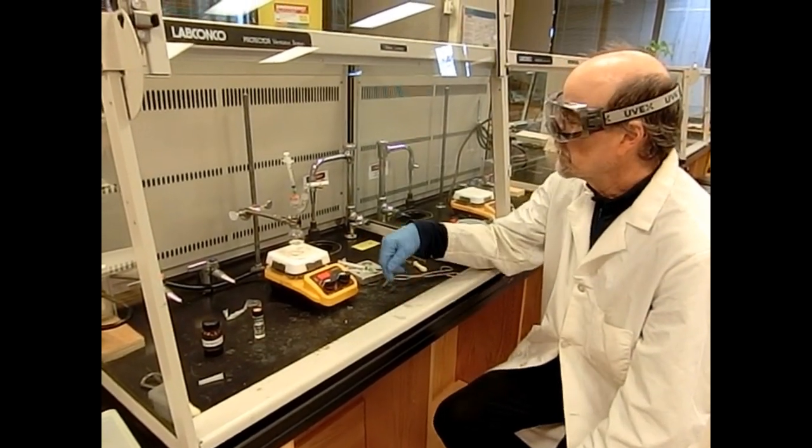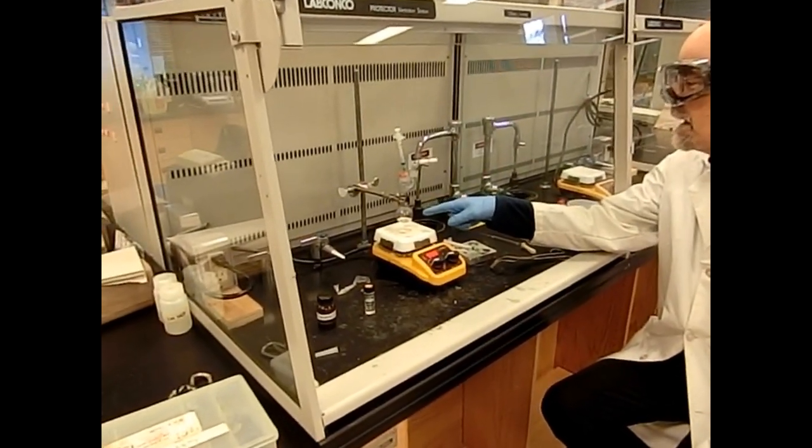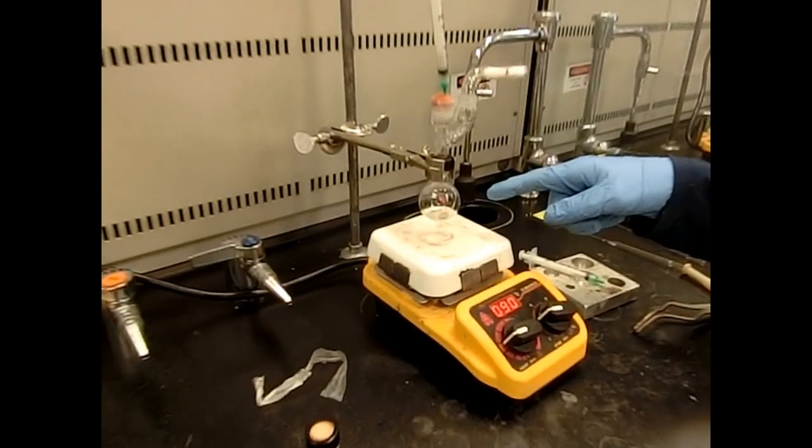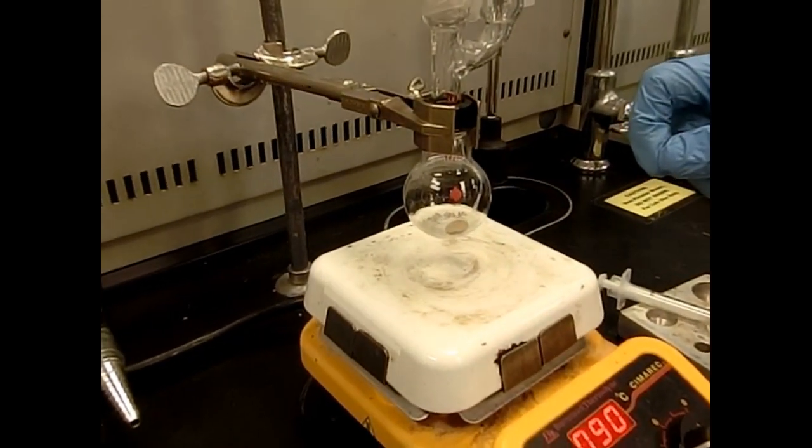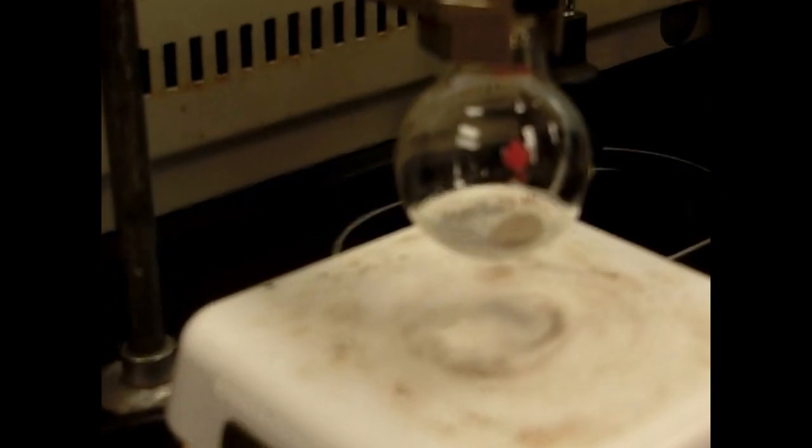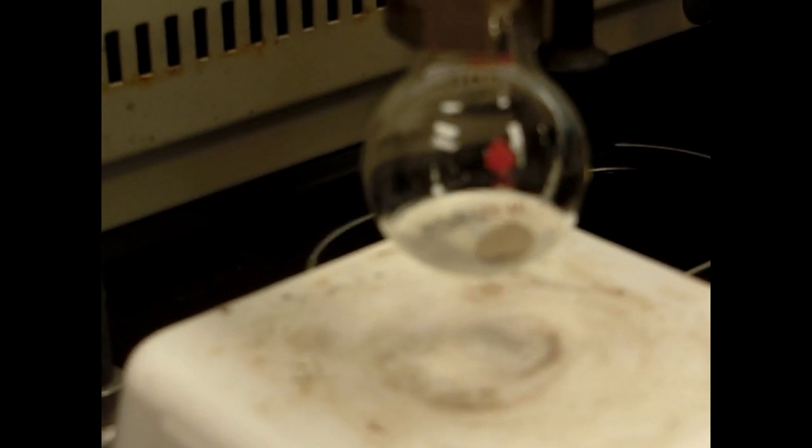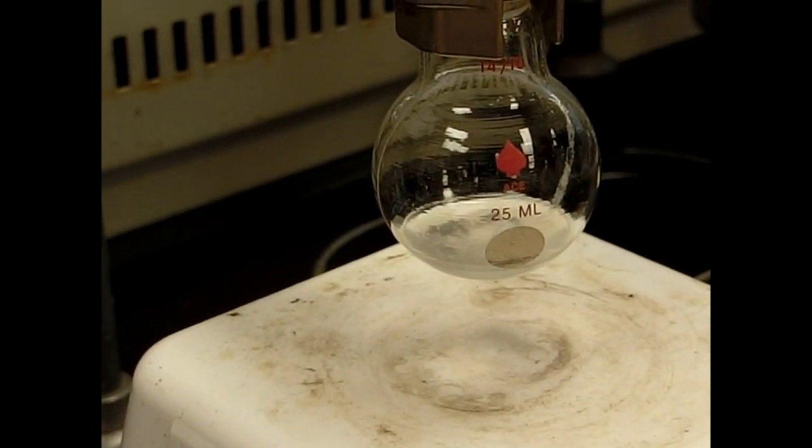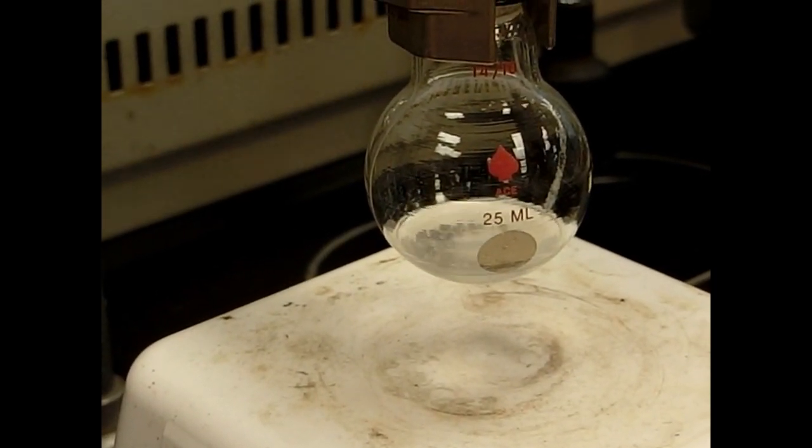So this is a good sign. See how the solution is getting a little bit cloudy? And this is an indication that the reaction has started. And we'll keep stirring and hopefully it'll get a little bit more cloudy and a little darker as time goes on. So I think we're on our way.